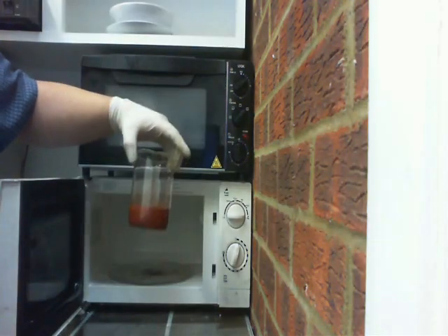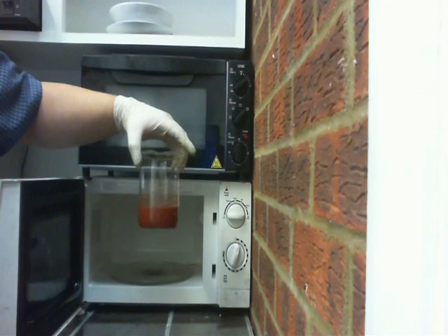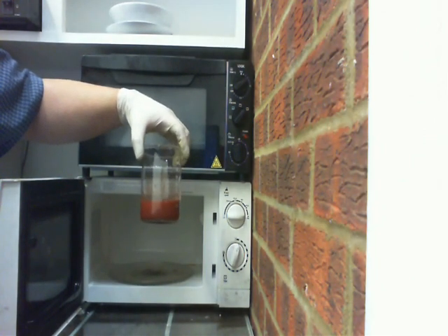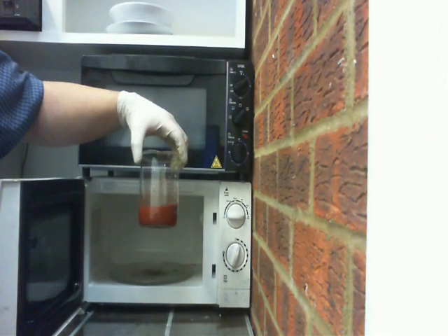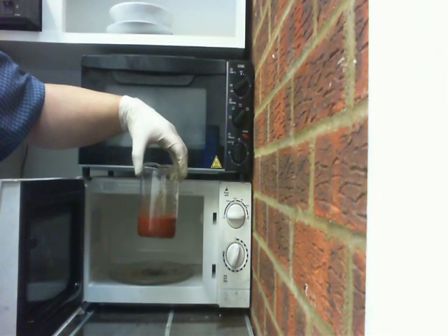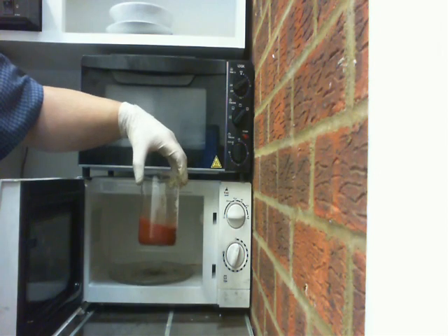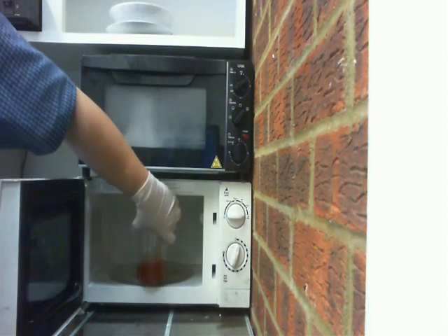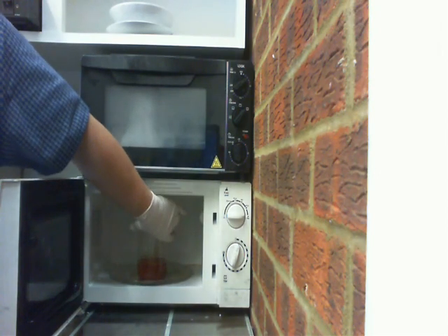After about five minutes you can see it's gone from its brick red colour to a brownish orange colour. It loses water through this process, so about halfway through I add another 25 millilitres of water.